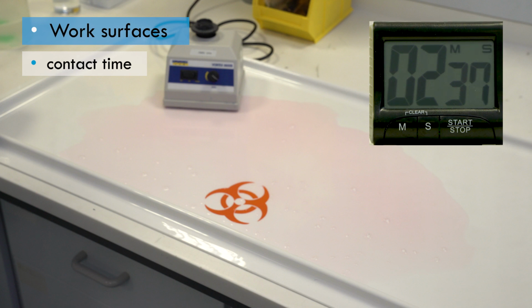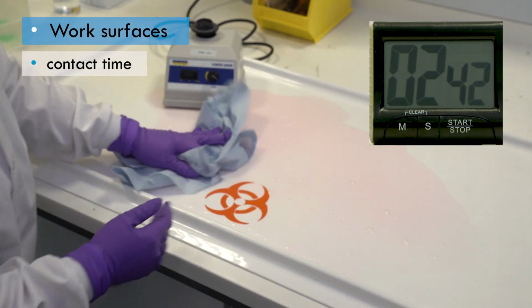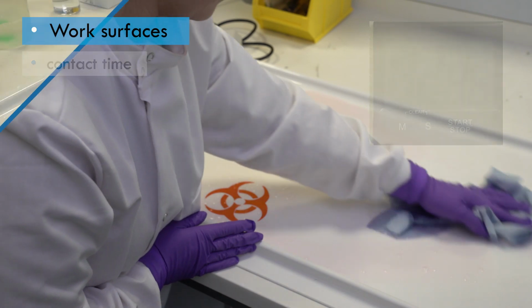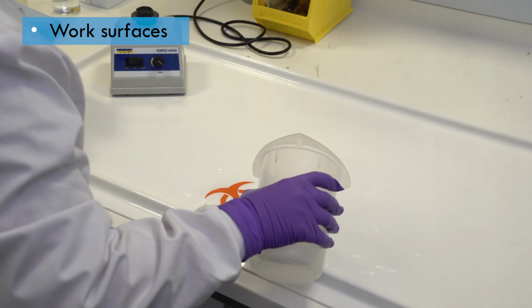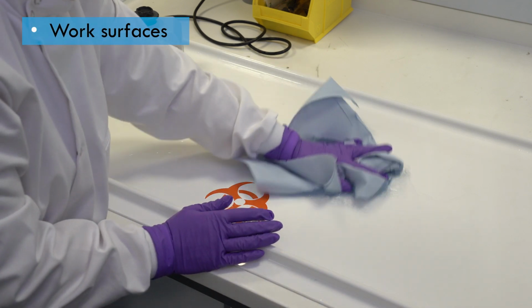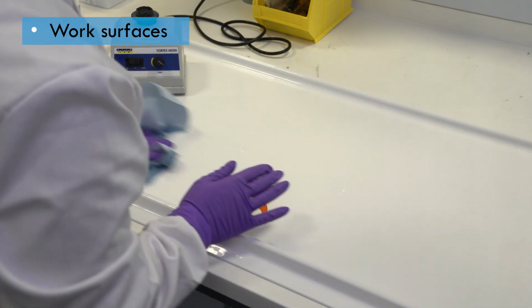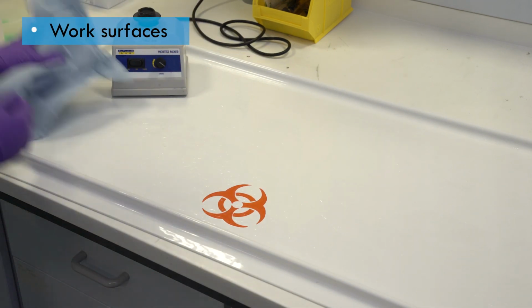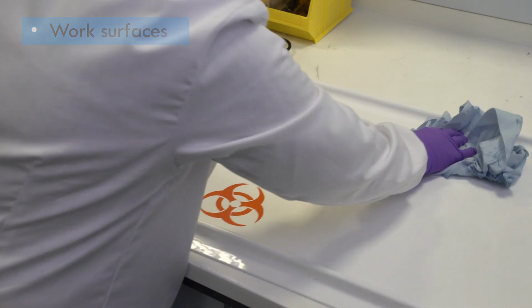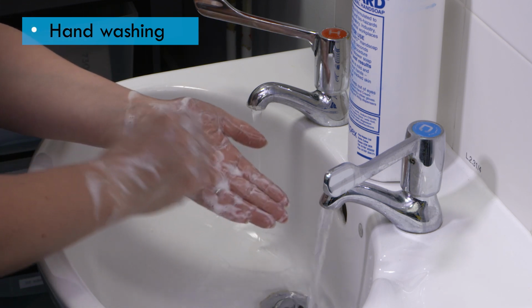If the disinfectant evaporates before the contact time is up, the timer should be stopped and disinfectant reapplied before restarting the timer. If the disinfectant is a type that leaves any chemical residues that could harm skin or damage the work surface, these should be wiped away using clean, sterile water. Finally, the surface must be wiped dry before use. Hands should be washed after any decontamination procedure.